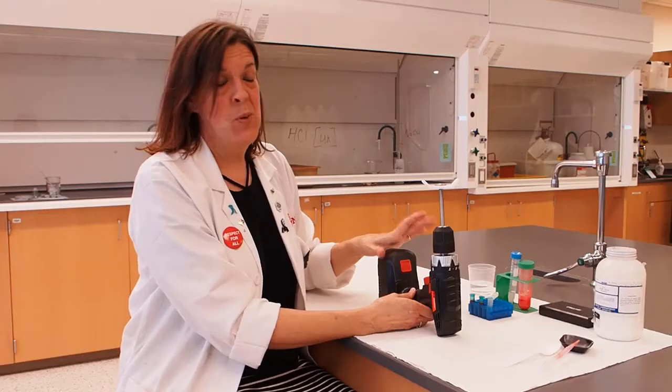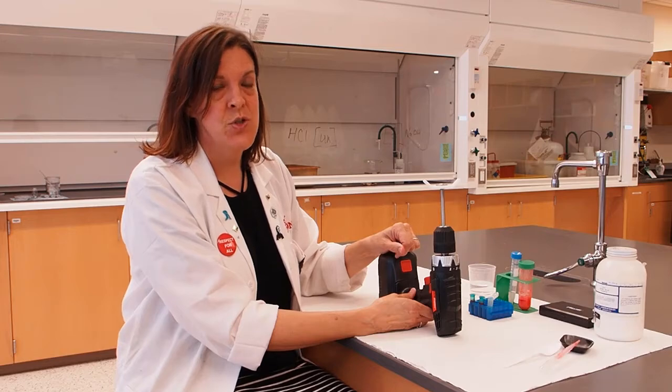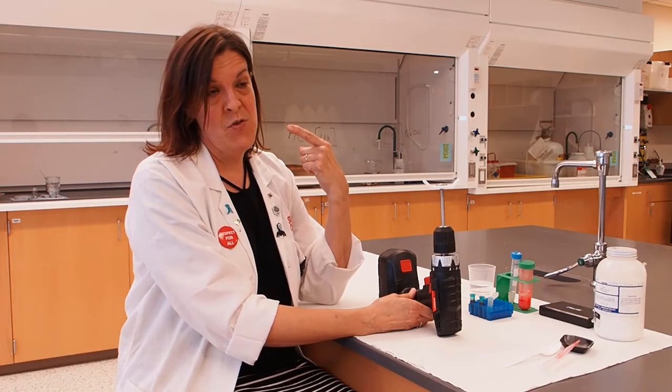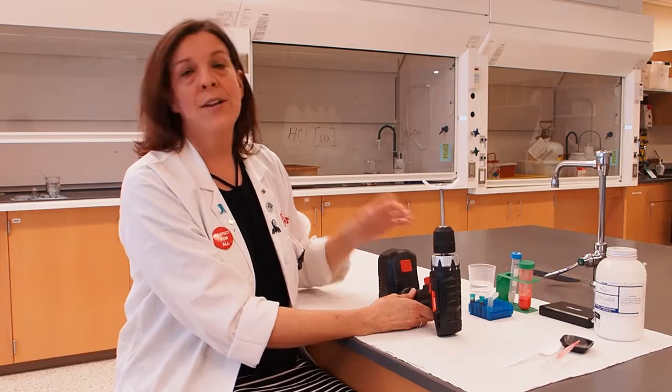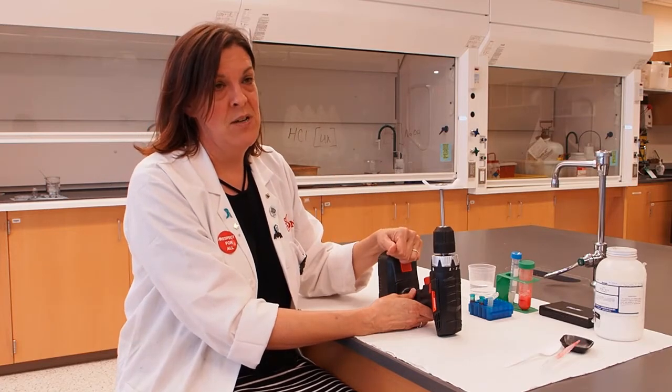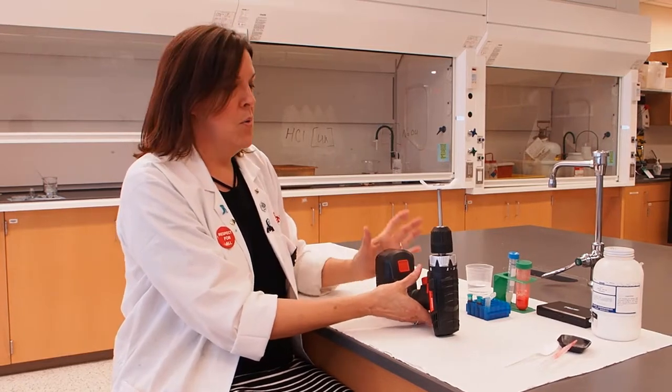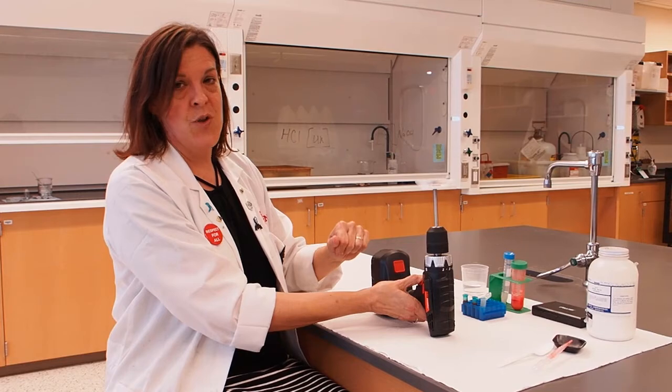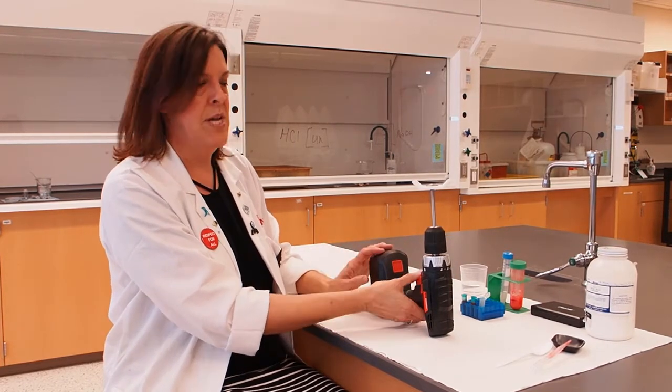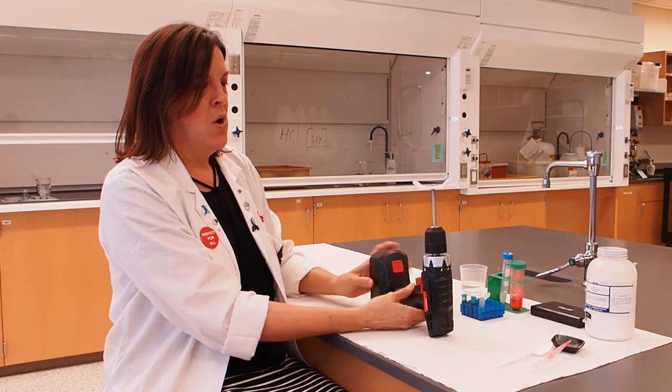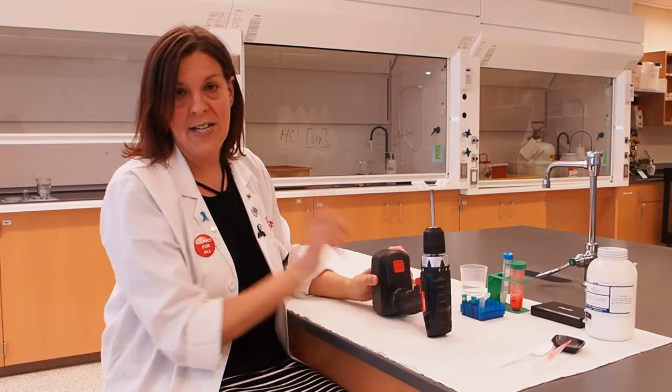Two important safety reminders. One is that when you're using your drill centrifuge, you never want to point it towards your face because we want all of your beautiful faces to remain intact. And you're never going to point it at someone else, no matter how mad you are at your brother or sister. So we're always going to point it straight up. Probably the best is just if you can lie it on the bench and just point it straight up, or you can point it away from you. That's safety thing number one.